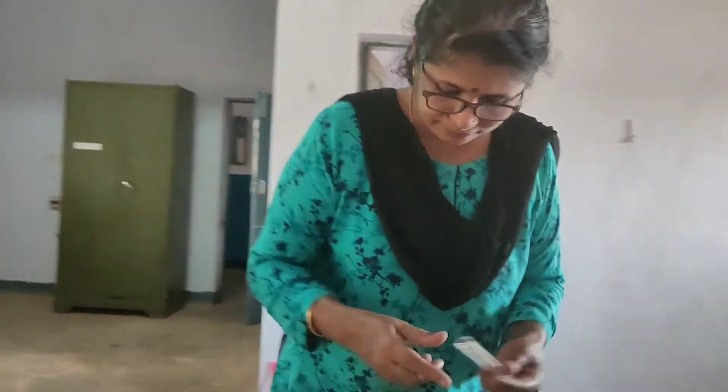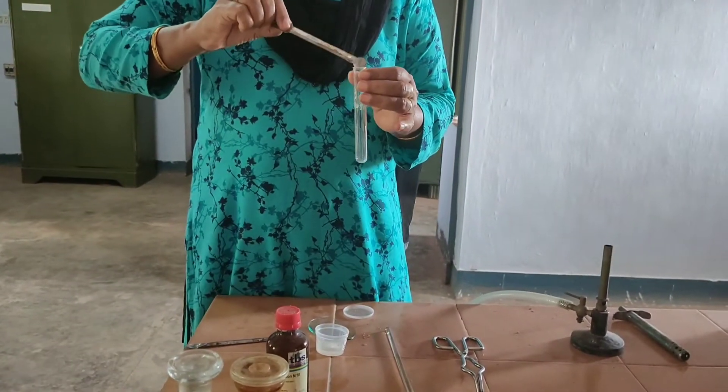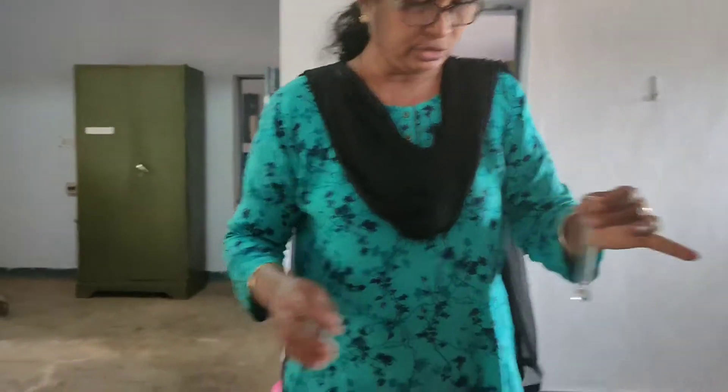Now, analysis for the anion must be done systematically: first with dilute HCl, second with dilute sulfuric acid, third with concentrated sulfuric acid, then with barium chloride. Take a little salt and add dilute HCl. There is no reaction at all, so there is no smell. This indicates absence of carbonate, sulfide, etc.